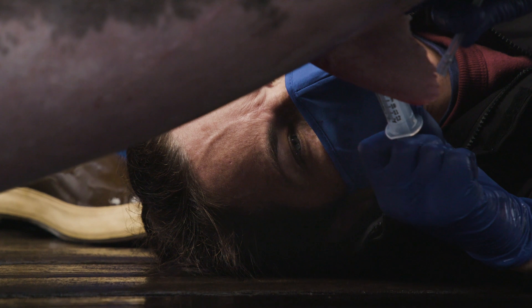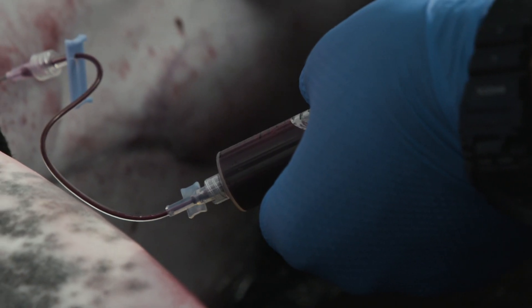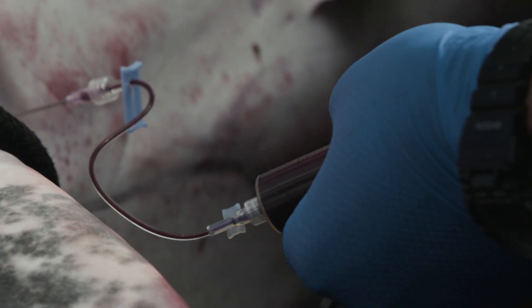I think most people expect me to say that we're using a needle that's like this long, but they're anywhere between an inch and a half to two inches. We often put an extension set on this so the animal can move, but the needle stays the same. This setup here is actually for the very next shark that we're going to catch.